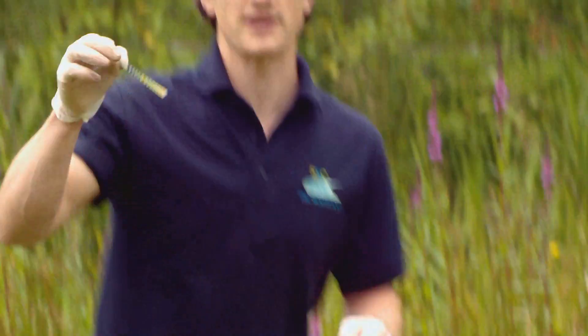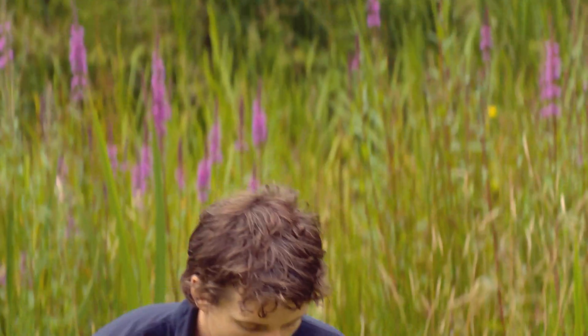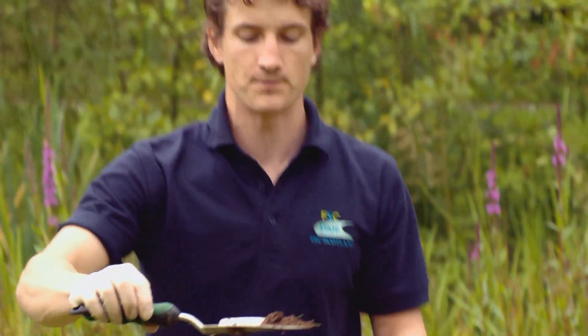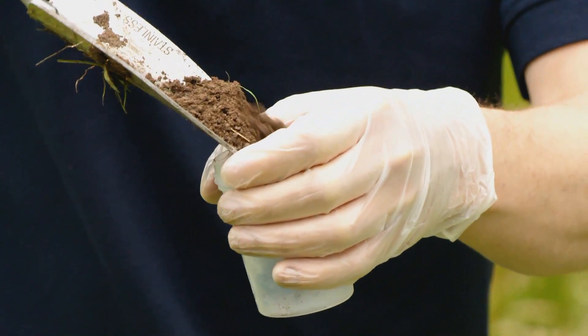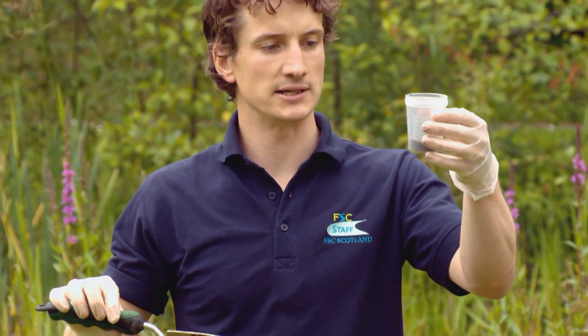Today I'm going to use the OPAL pH test strip that you get in the soil and earthworm survey and also the water survey. They look a little bit like this. Before I measure my soil pH, I need to take a soil sample. I'm taking this from about 10 centimetres depth in my soil pit here and putting it into a plastic beaker — a plastic cup would also do nicely.